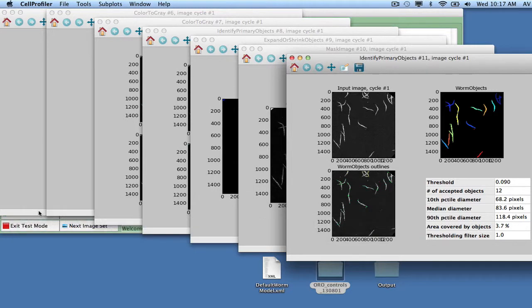At this point, both single worms, clusters of worms, and possibly some debris have been identified as worm objects. It's worth mentioning that the identification steps are the same as in Pipeline 1. The same preprocessing and foreground-background segmentation should be applied both when creating the worm model and when running. In this display, the individual worm objects are assigned unique colors.